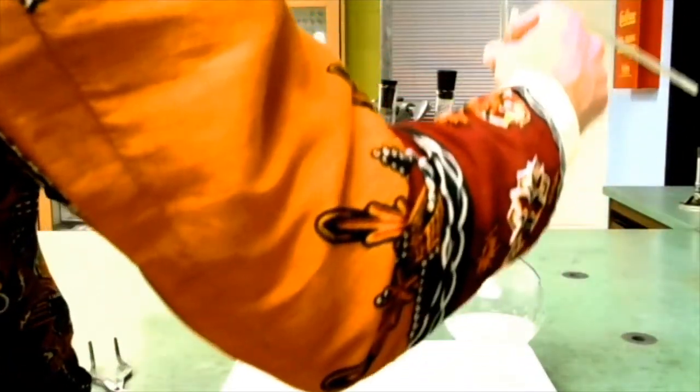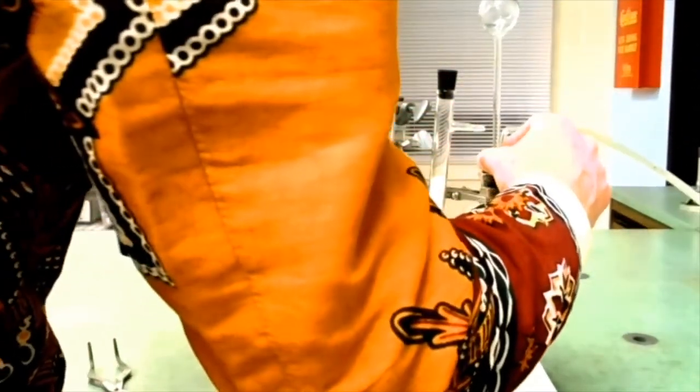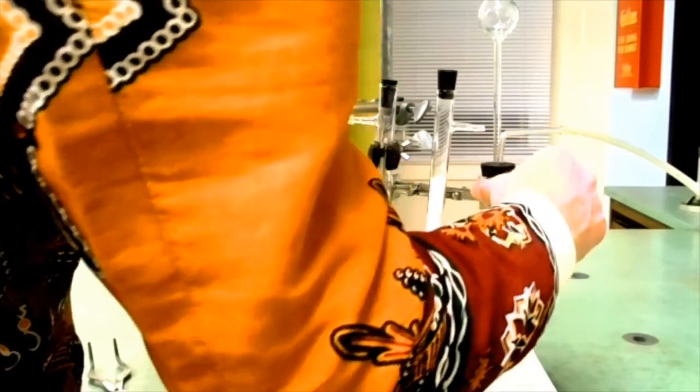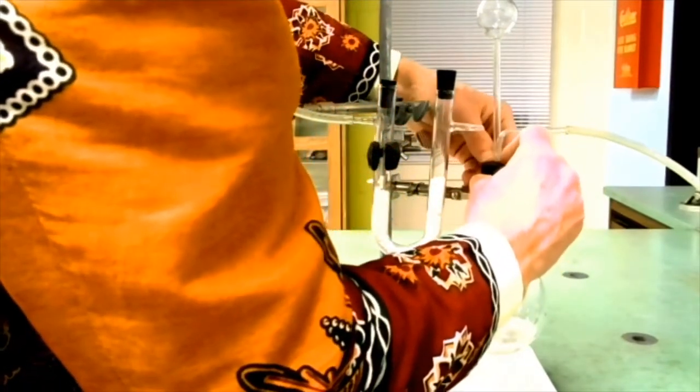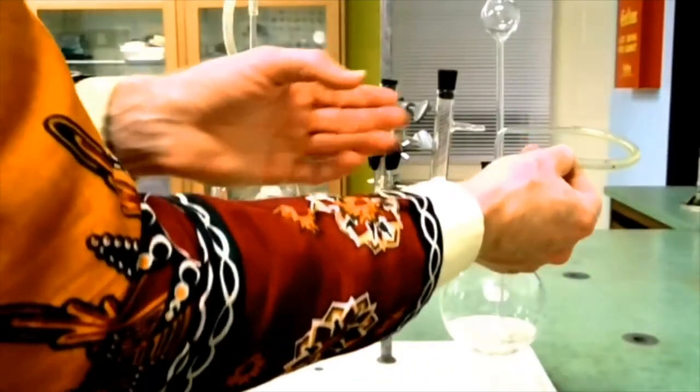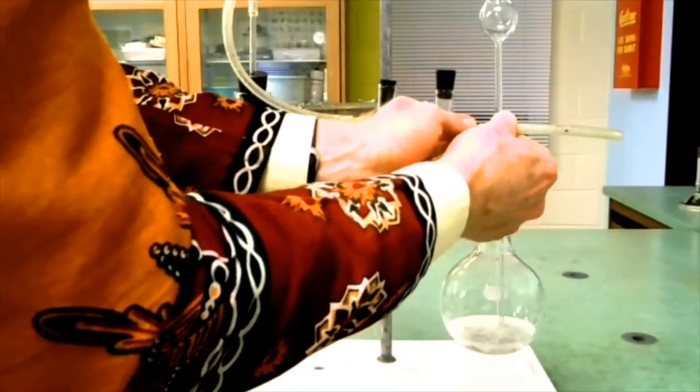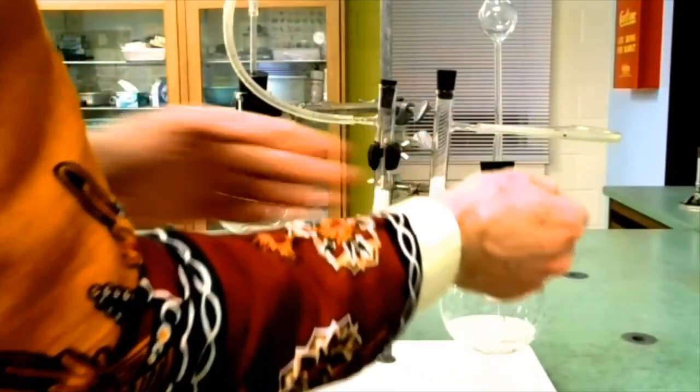Next, put in this delicate apparatus, the thistle funnel, and connect that output to this input, being careful not to break anything.